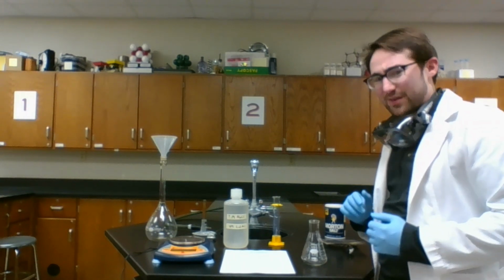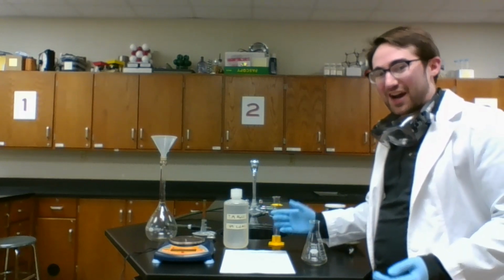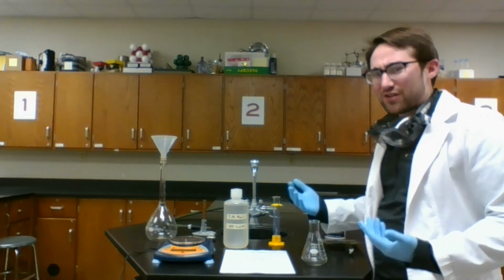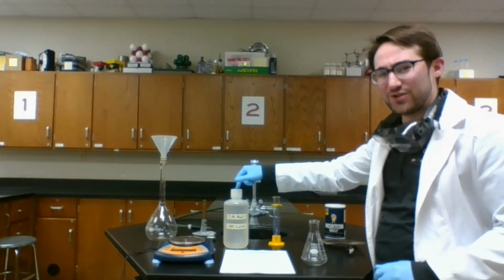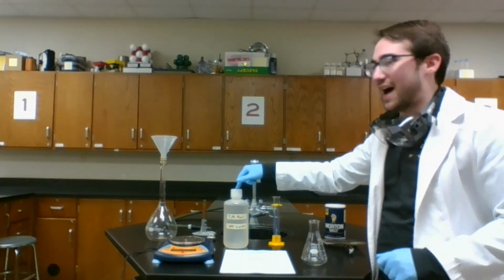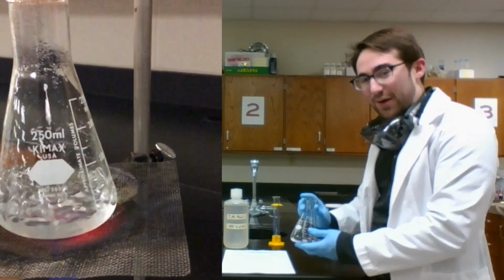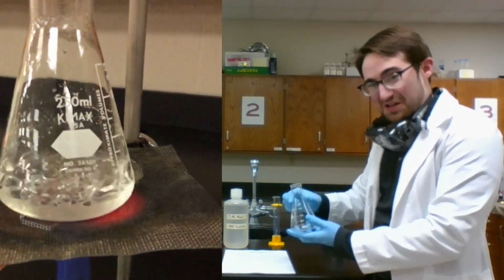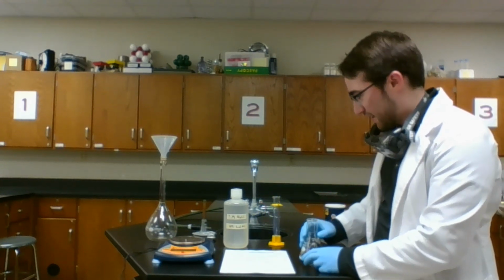Now, I could use something like a beaker. Beakers are pretty standard, they're temperature resistant, they're kind of our catch-all for lab glassware. But as I boil off this water, I'm going to have a lot of bubbling, and as soon as I start getting this solute to undissolve from the water, as I run the water out, as I boil it off, I can get some popping and things can start flying out. It's going to be hot. So instead, I'm going to be using an Erlenmeyer flask, or a conical flask, so that way I've got some kind of coverage here that will keep stuff from spitting out at me as the solution boils inside here.